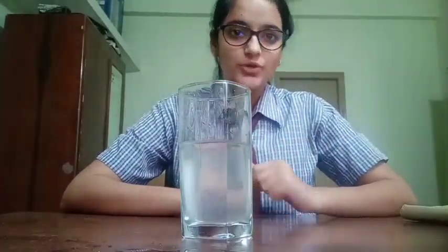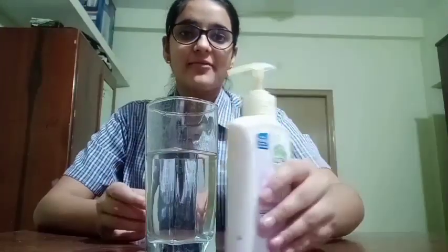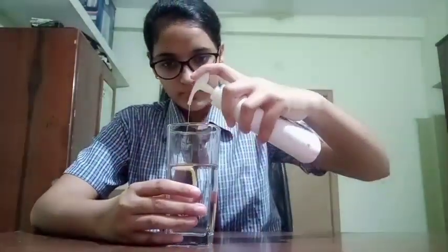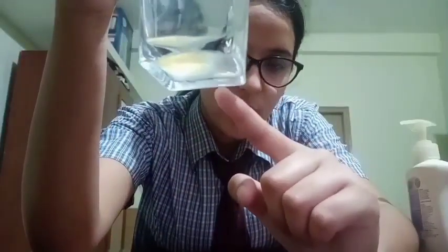Next, let us move on to bases. I have sodium stearate, that is C17H35COONa, which is hand wash, and an amount of water. I will pour it in. After some time, we can see the sodium stearate collecting at the bottom, so we can say that the base is insoluble. Bases which are soluble are called alkalines.